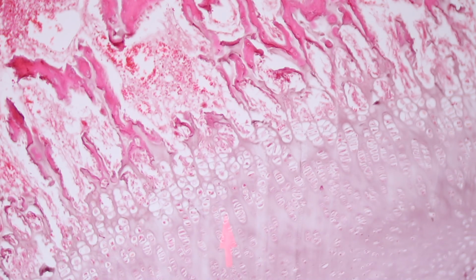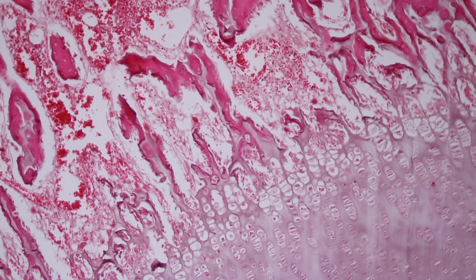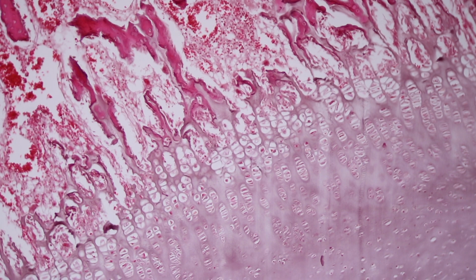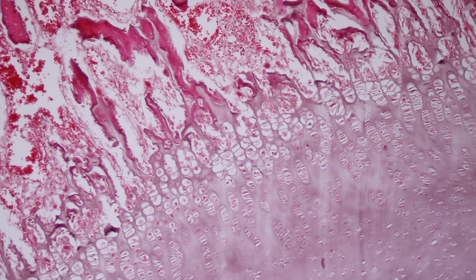What age approximately is like at this level of development? What kind of age is this? A fetus that's in gestation, or a newborn baby? No. So this is a fetus about 6 months of age. And then how about the previous one you showed with the whole knee joint? Yeah. So that was about 4 months of age. Okay. So it really changes a lot in just a short couple months.